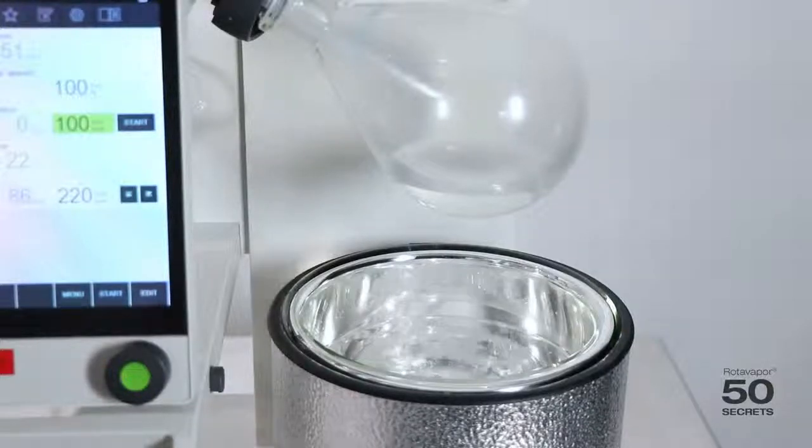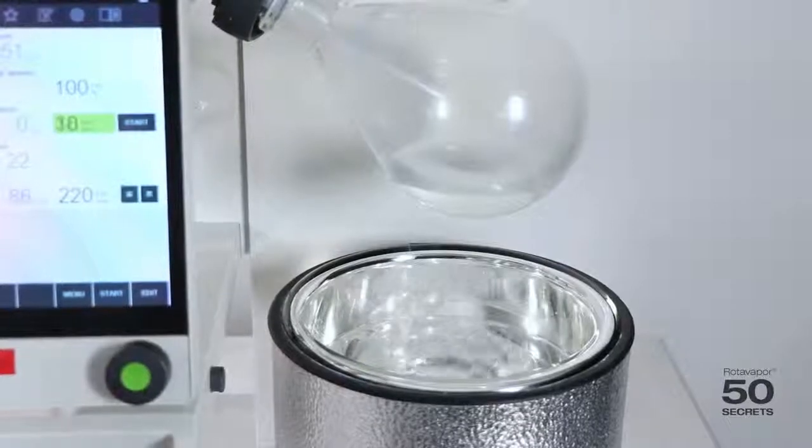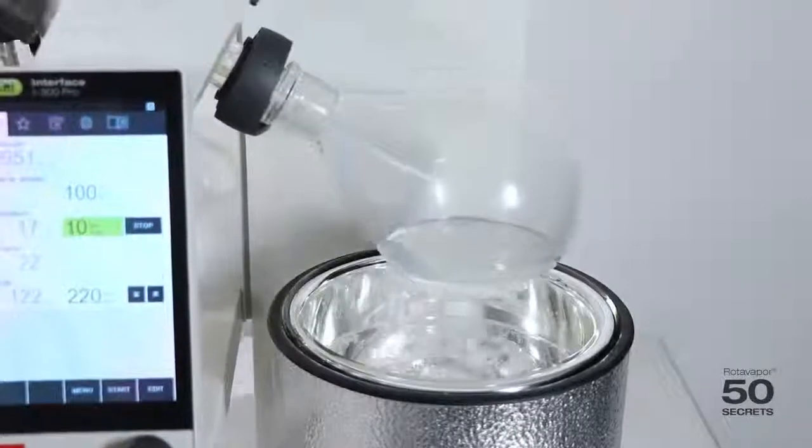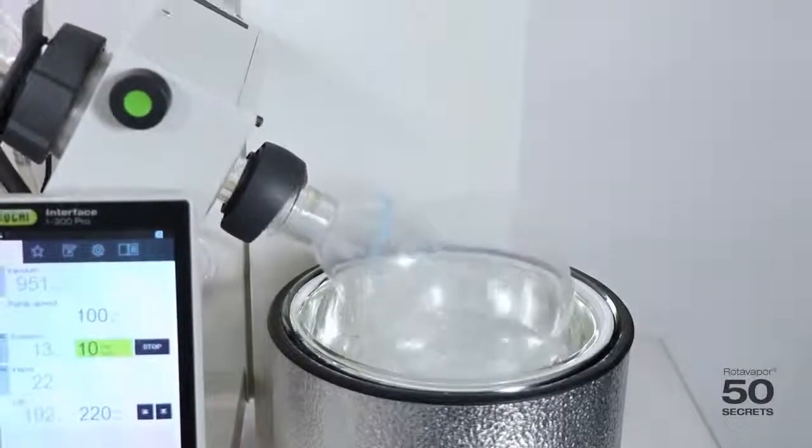Third, we start the rotation, and we set it to about 10 RPM, and we gently go into the liquid, just like this.